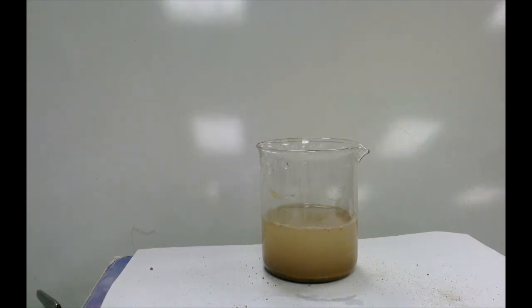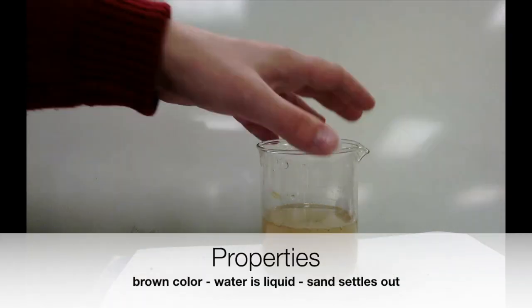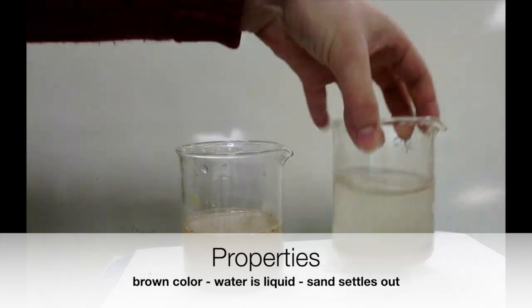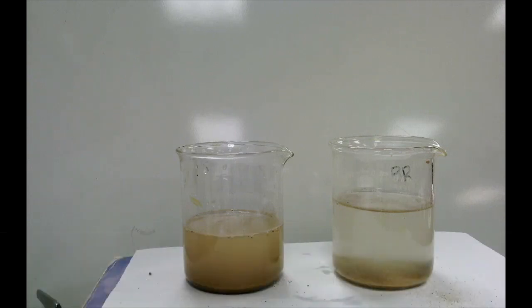So some of the properties of our combination here is that it's brown in color. We can tell that the water is still liquid, but the sand is still a solid. And the sand is starting to settle out of the water. In fact, if we were to leave that beaker for long enough, it would look like the other beaker that I just sat down, where almost all of the sand has settled out of it. Sand and water is in fact an example of a mixture.